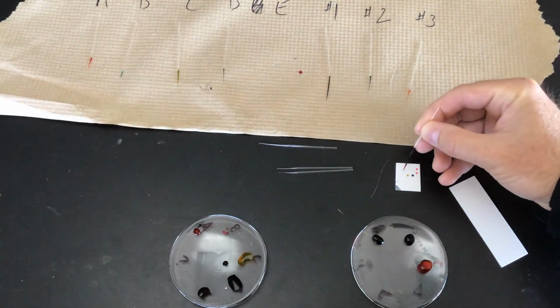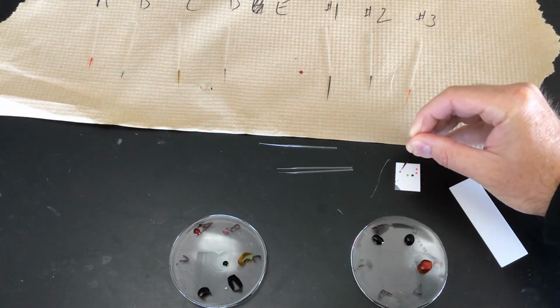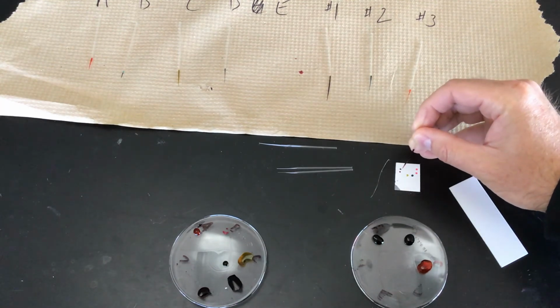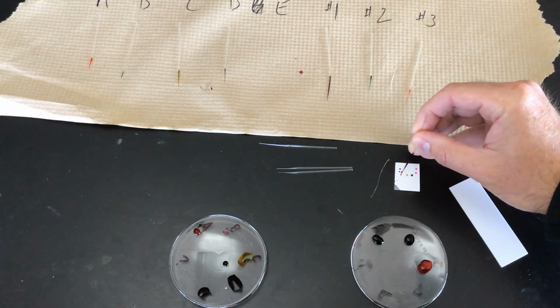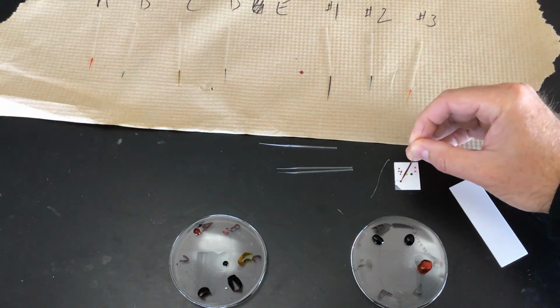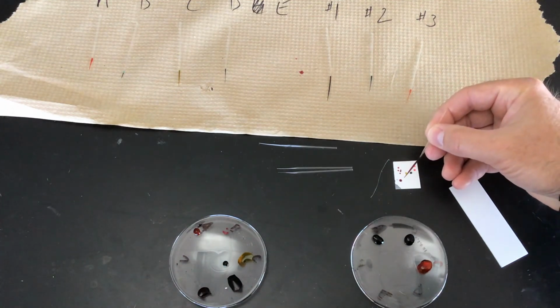So let's try it out. No, it's actually pretty good. For all these, doing a little tap and a little tap is better than just holding it down because it'll get really big. And so I would say that this one right here that I just did is too big. You'd want something maybe half that size.